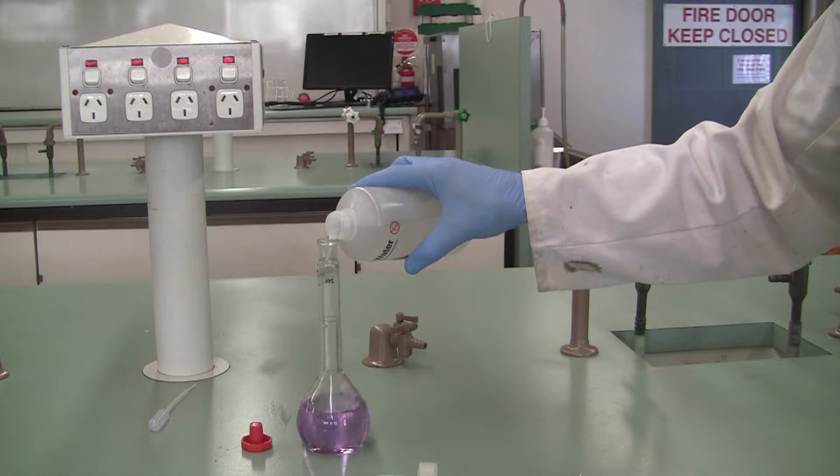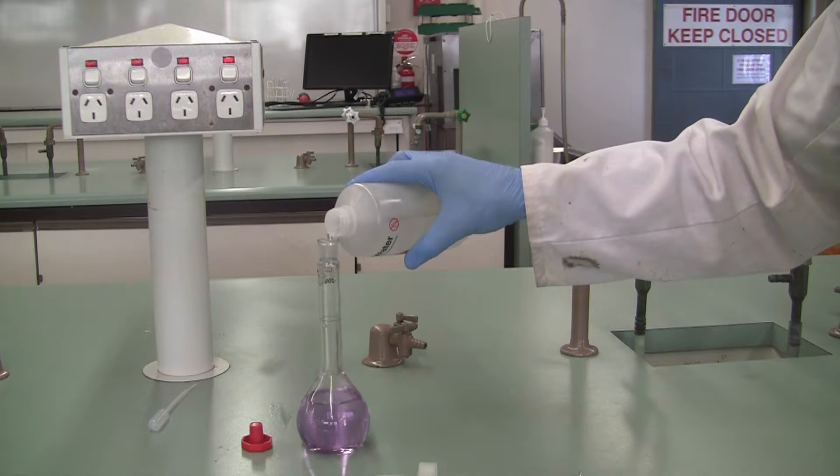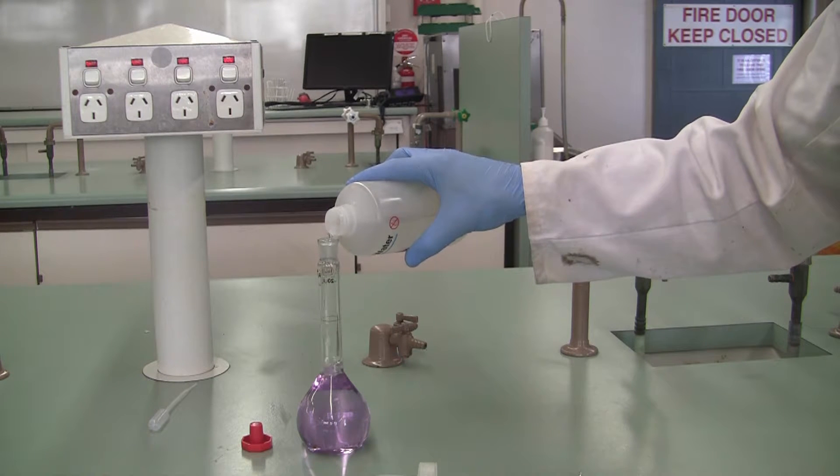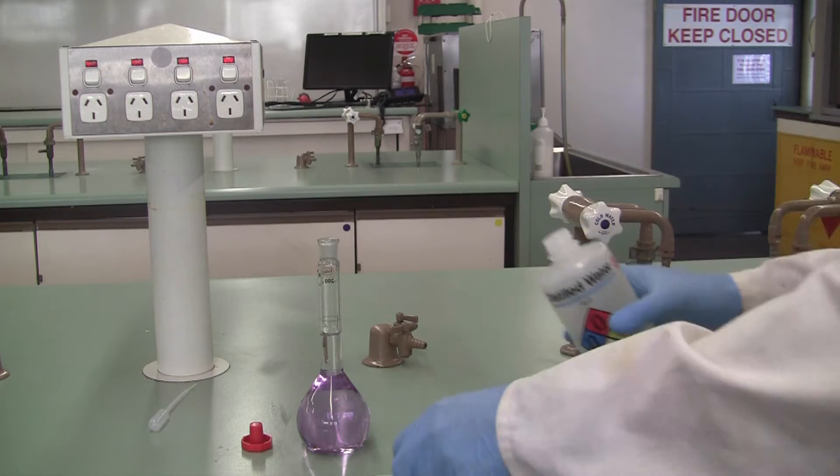And then once you're getting close to the top, you can fill most of the way up the neck towards the line. Don't get too close by pouring with your bottle. I don't want you to go over that mark.